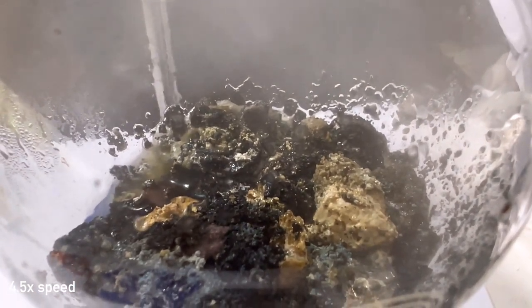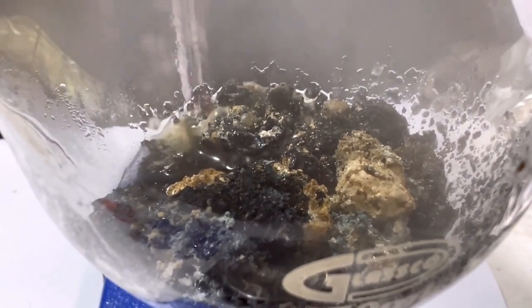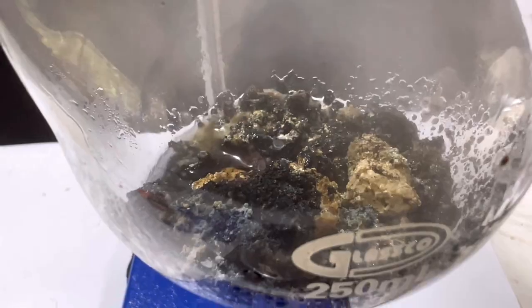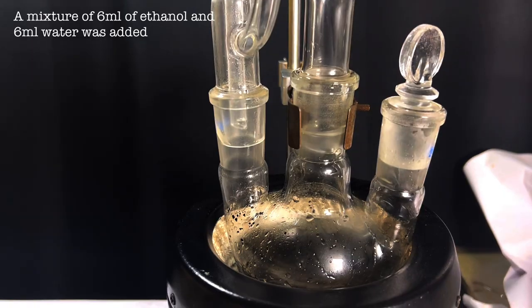In this clip you can see excess sodium reacting with ethanol. Once all the ethanol has been added we add a mix of 6 ml of absolute ethanol and 6 ml of water.